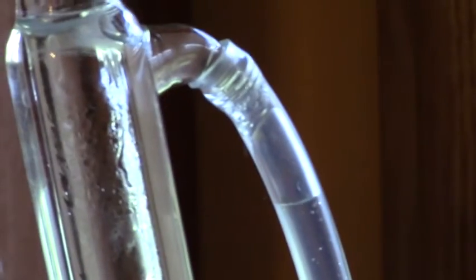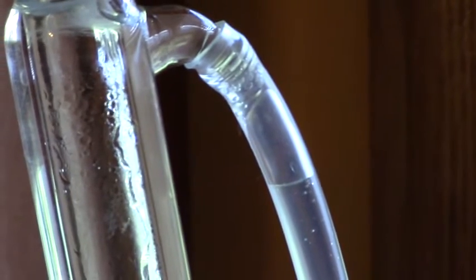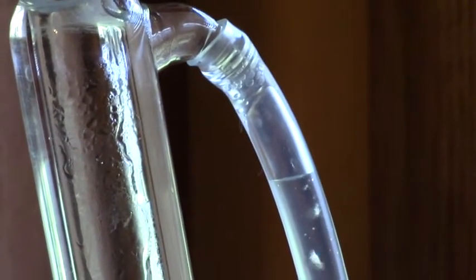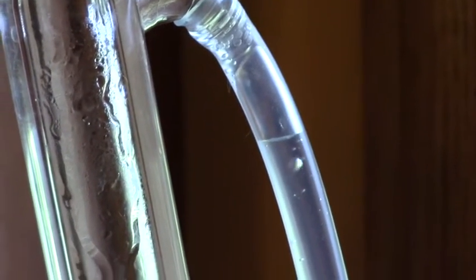Sorry if I make people dizzy, not my intention. There we go, it's better in focus now. There's a little bit of water coming down, you see the bubbles?